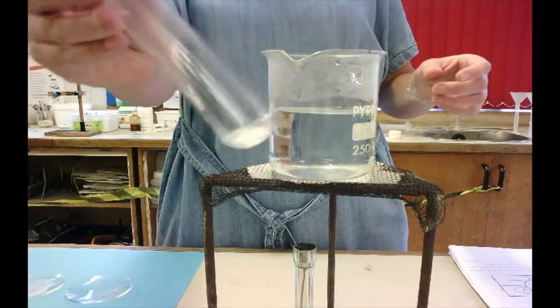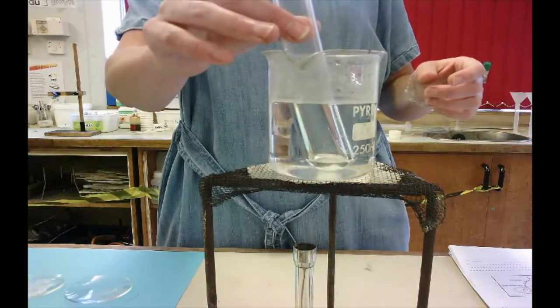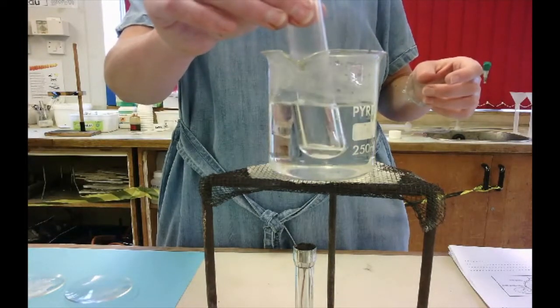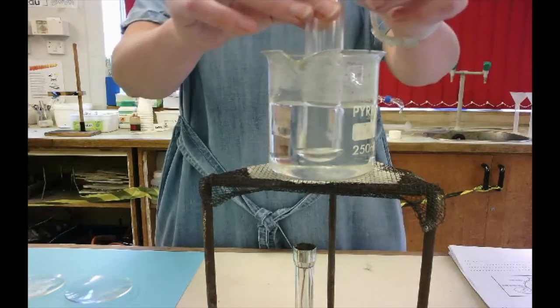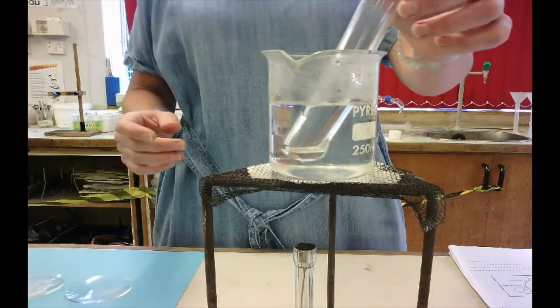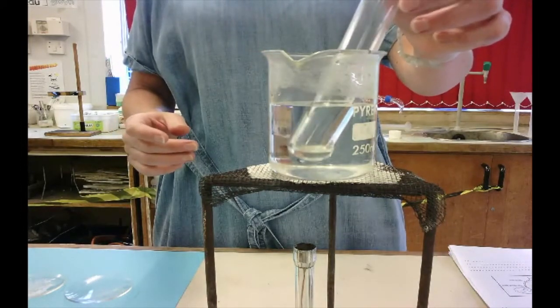It's becoming a colorless liquid from the heat of the water. You see, it's all melted now.